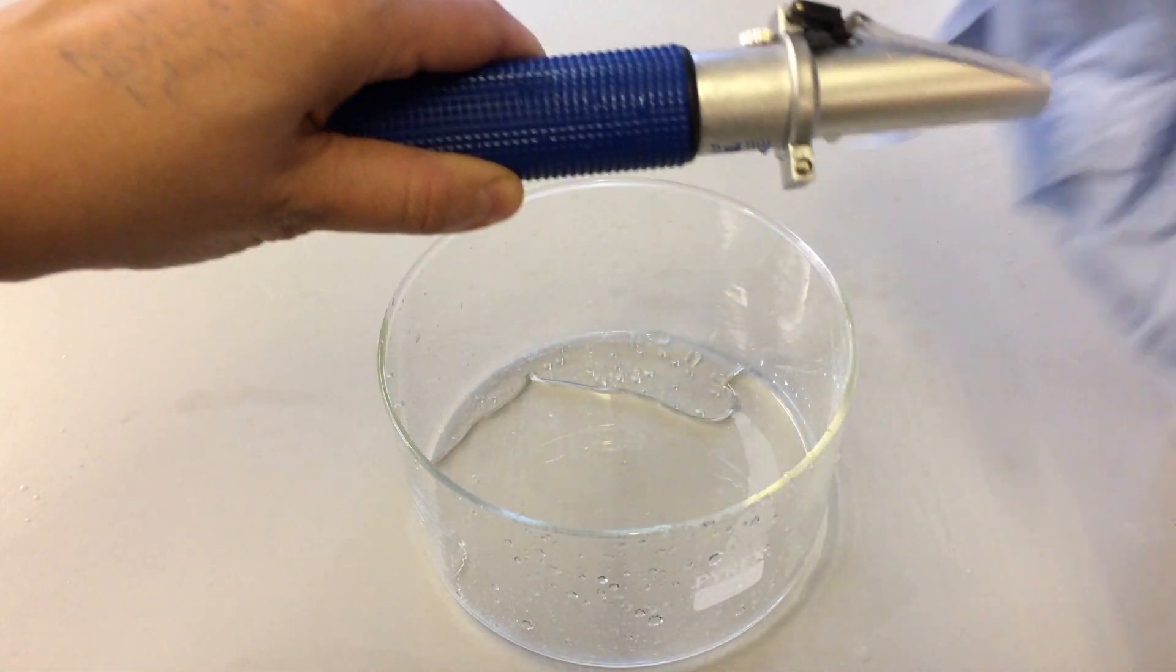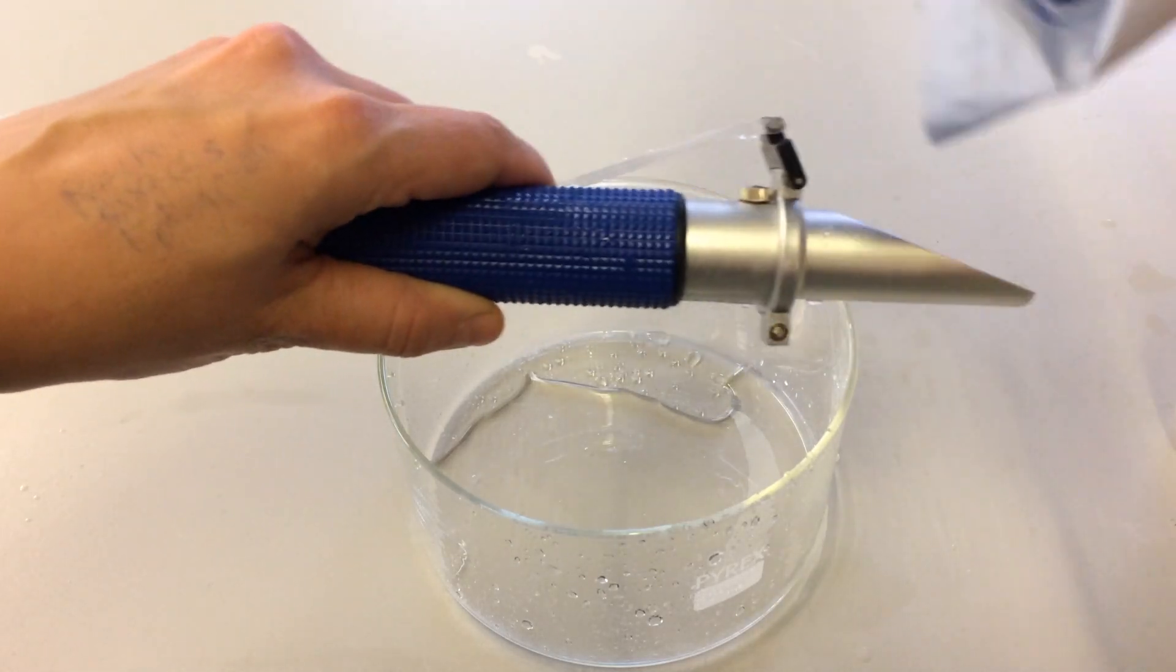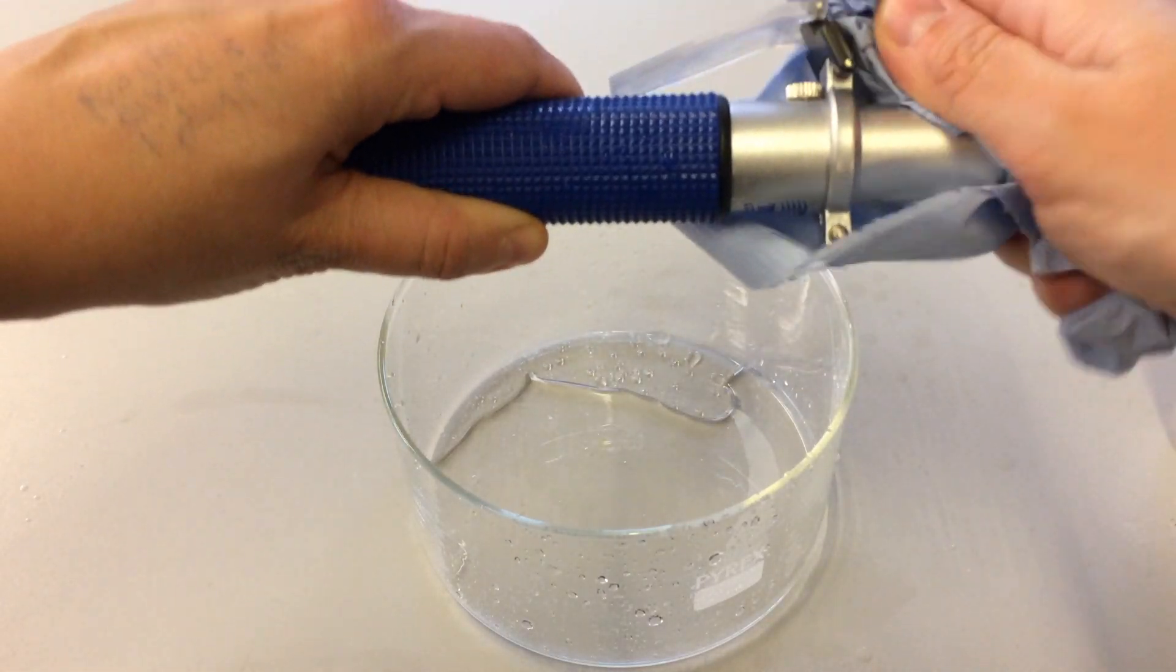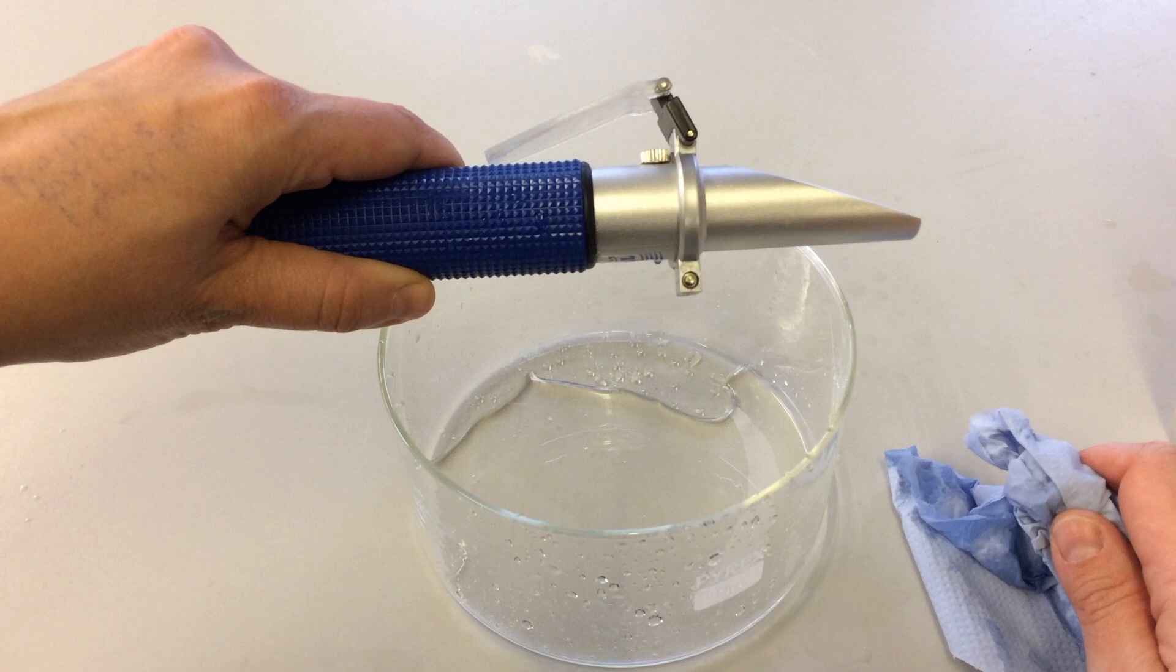We're going to make sure it's dried properly before we put it away into storage, so it's nice and clean and ready for the next person to use.